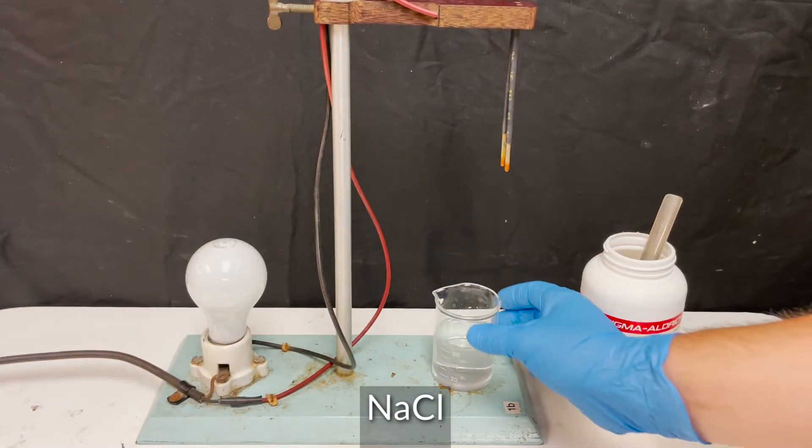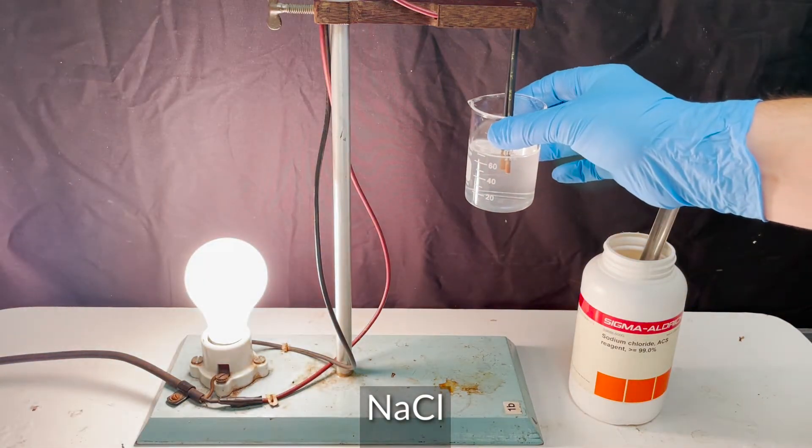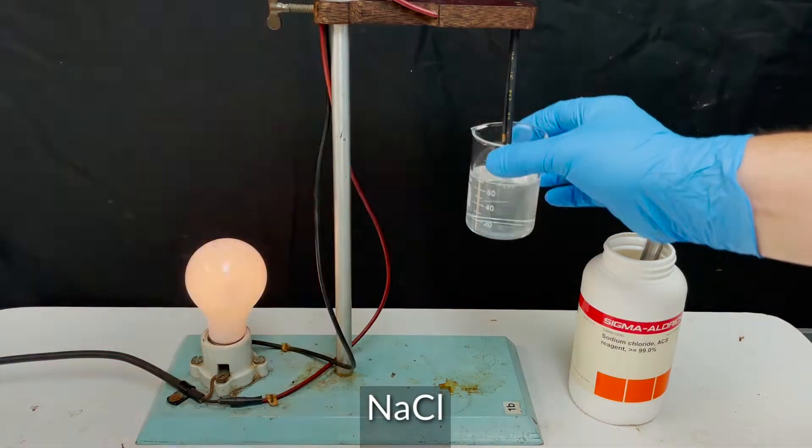When I test the conductivity of this solution, we're able to see the light bulb light up because this solution conducts electricity.